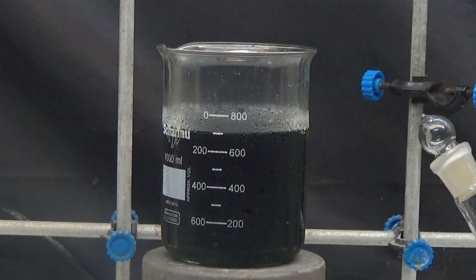Leave the glass in the refrigerator for 1 day. After 1 day in the refrigerator, shake for 2 hours to compact the insoluble yellow paste.